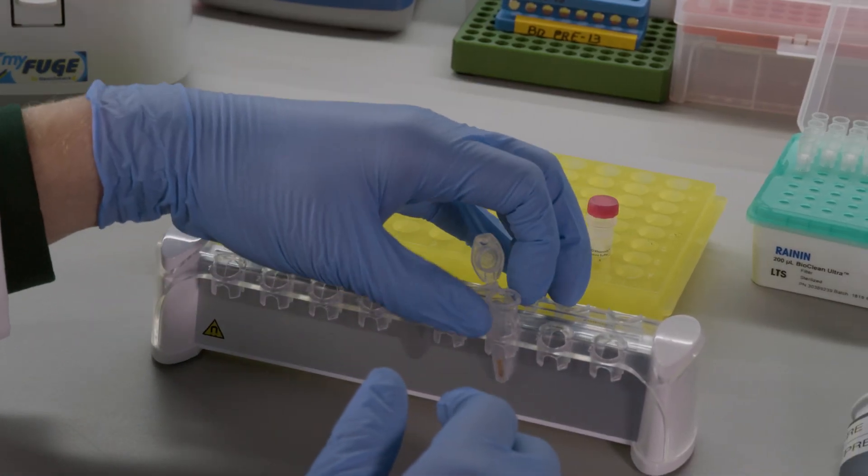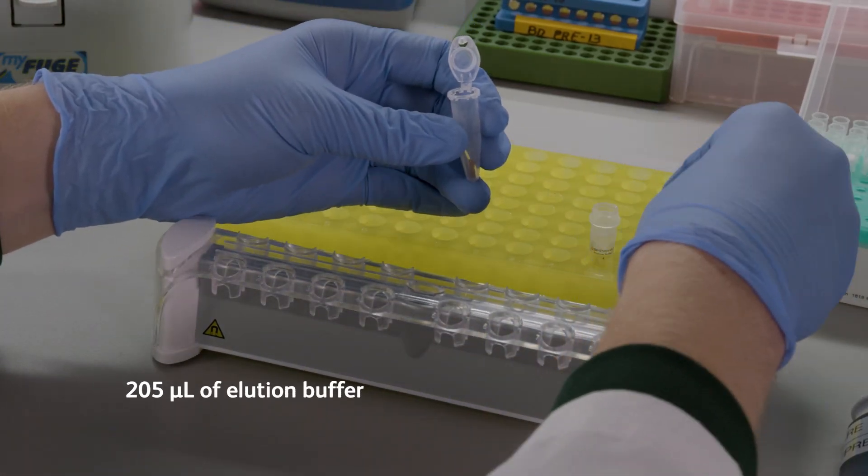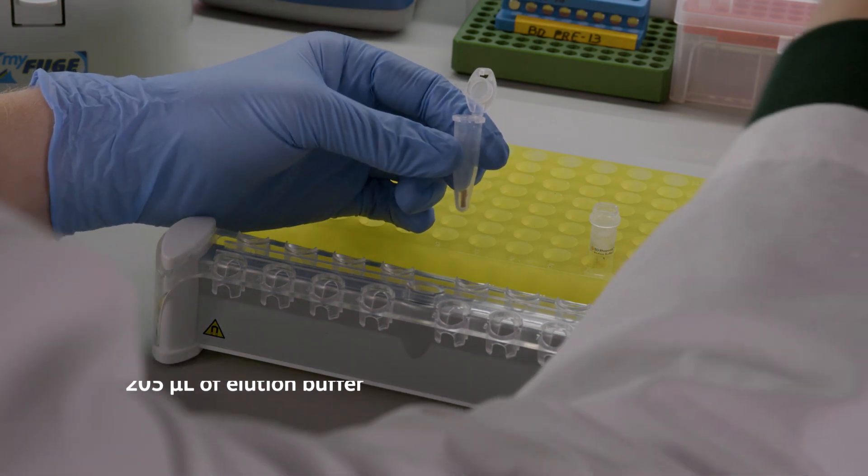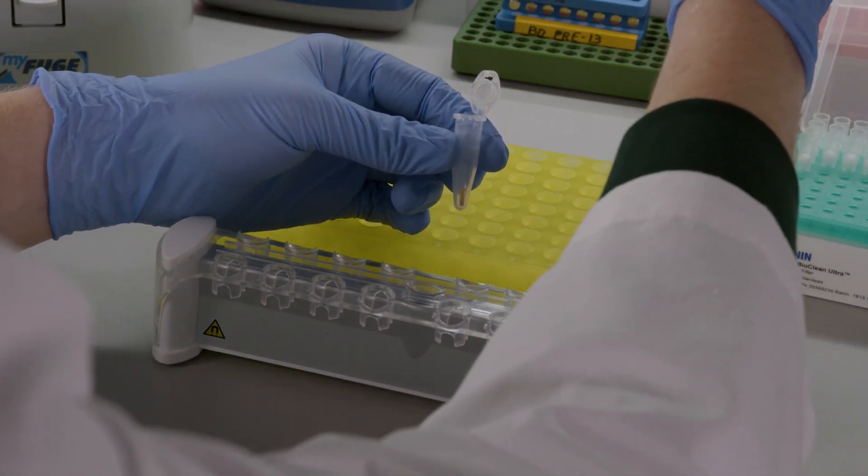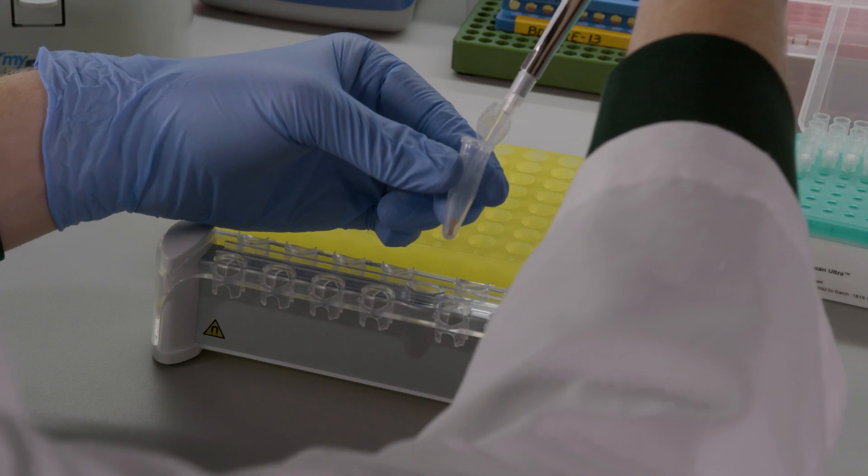Next, remove the tube from the magnet and resuspend the beads with 205 microliters of elution buffer. Make sure to reduce the amount of bead suspension that is stuck on the walls of the tube or the tube cap.